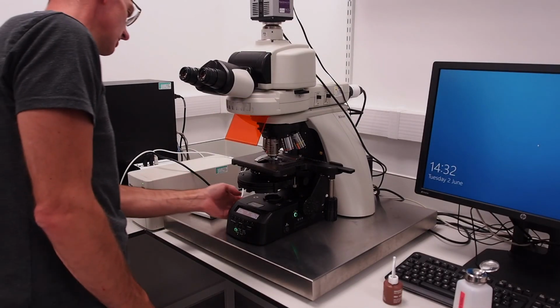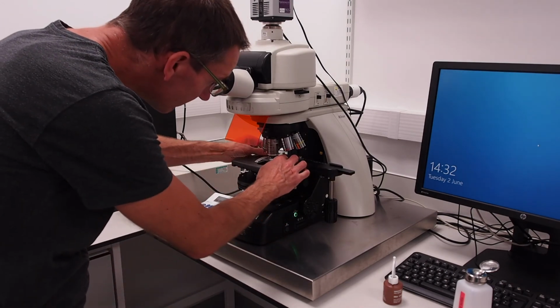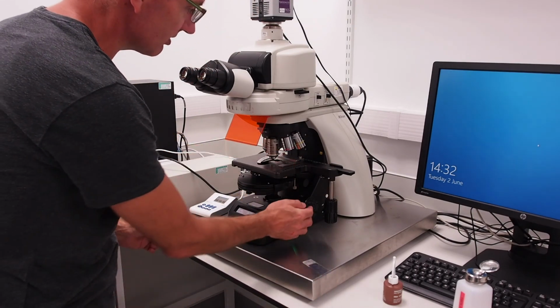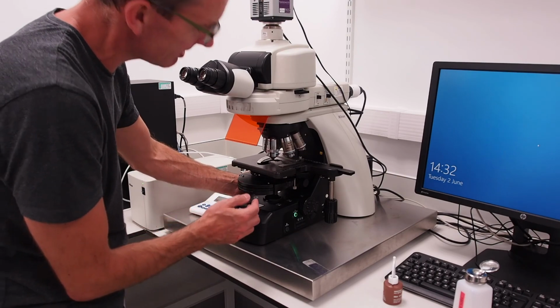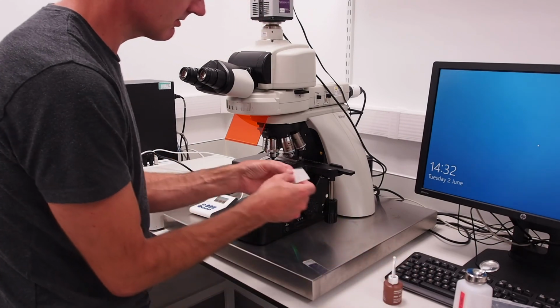To remove your sample, press the button labelled Escape on the lower left-hand side of the microscope body to lower the stage. Carefully remove your sample from the stage, then using the two buttons behind the left-hand focus knob, rotate the objective turret to the side to make the oil immersion lens easier to access for cleaning.